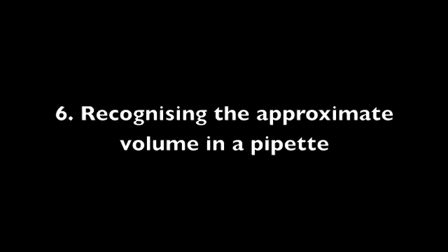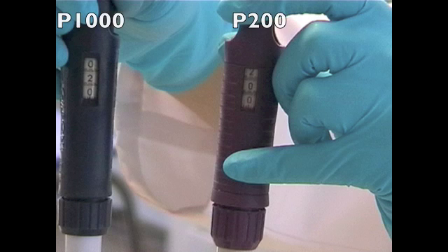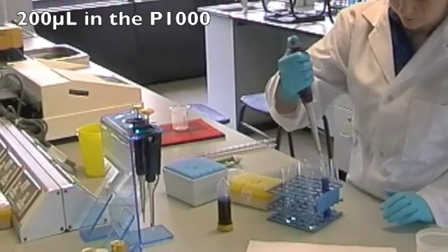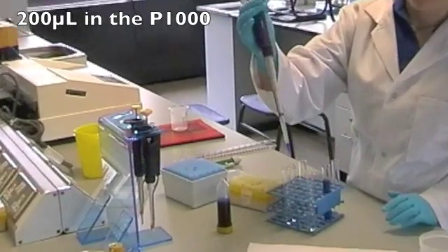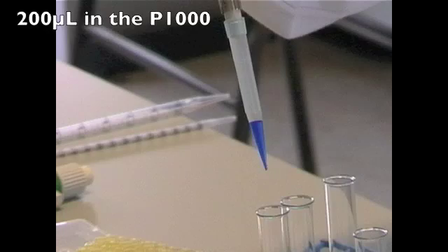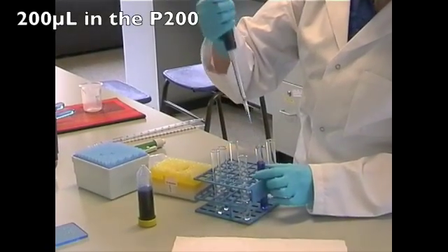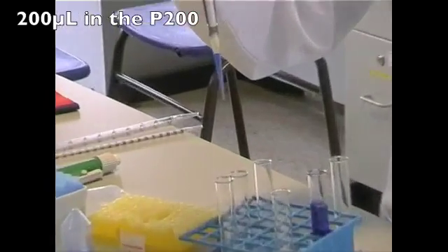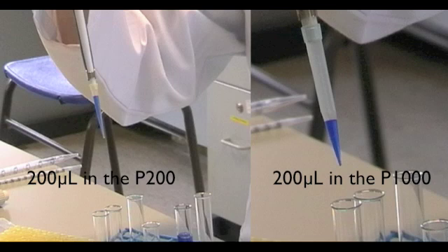Recognising the approximate volume of liquid in the pipette tip will aid you in accurate pipetting. Using the P1000 and P200 to measure 200 microliters, you will see that in the P1000, 200 microliters only fills one-fifth of the blue tip, while in the P200, 200 microliters fills the yellow tip to maximum capacity. Keep this in mind when conducting an experiment, as it will help avoid inaccurate pipetting.